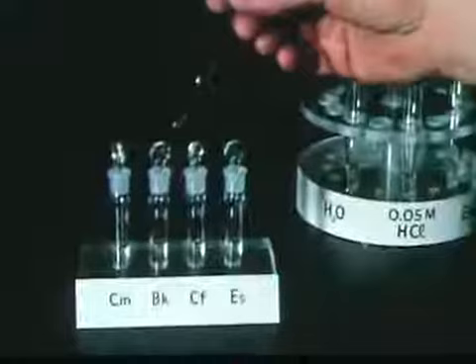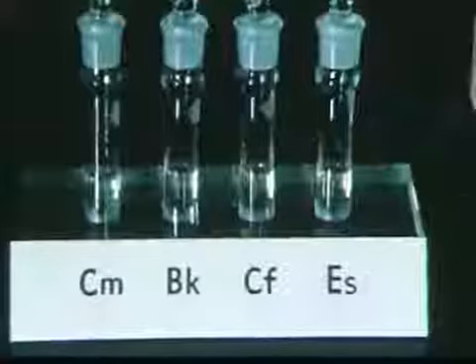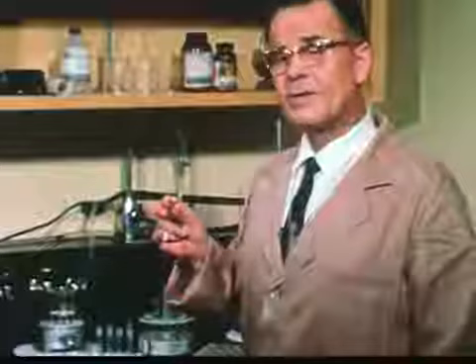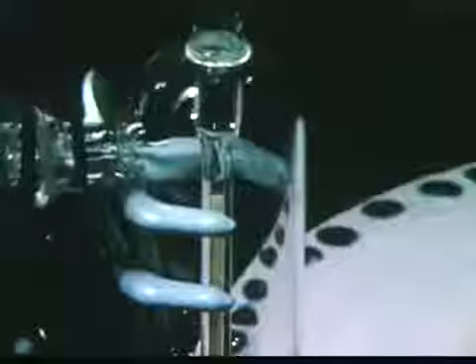Here's a solution containing equal amounts of tri-positive ions of four synthetic elements: curium-244, berkelium-249, californium-252, and einsteinium-253. We should mention that only small amounts of these elements actually exist. At the time of this filming, there is only about one-tenth microgram of einsteinium in all the laboratories on Earth. We're working with small amounts in extremely dilute solutions of concentration about 10 to the minus fourteenth molar. The level of radioactivity is quite low, and therefore it's safe to work with them in the open.